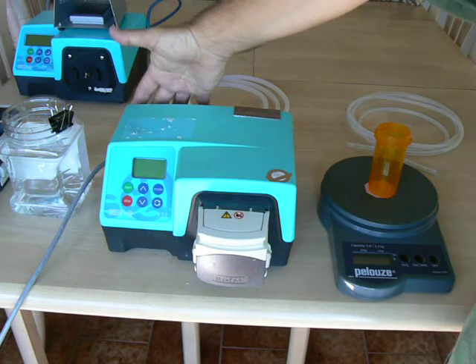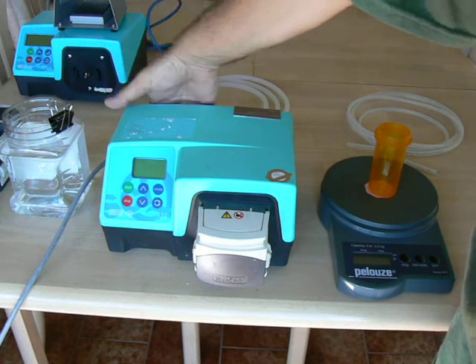The first thing you can do — the on/off switch is located near where the power cord enters the back of the pump.